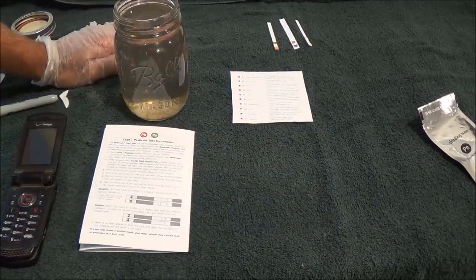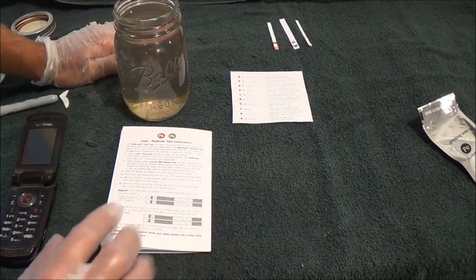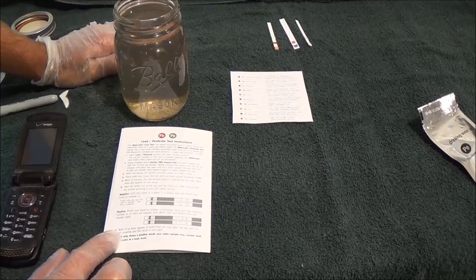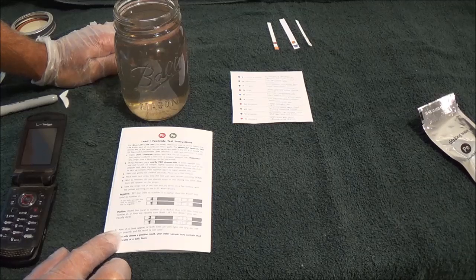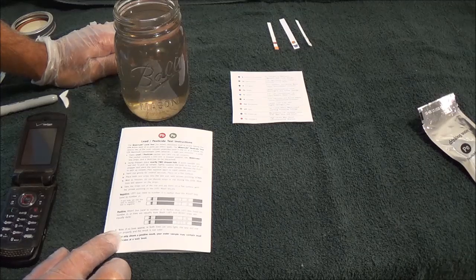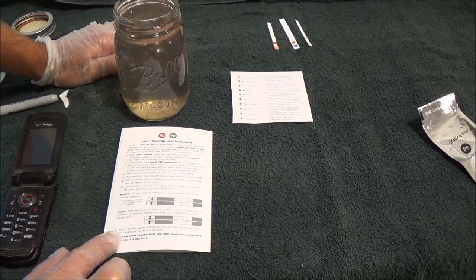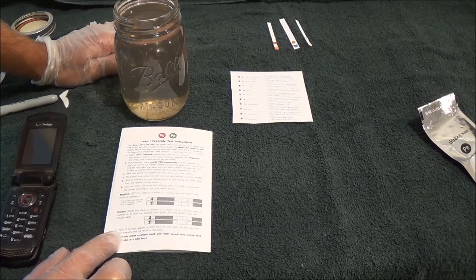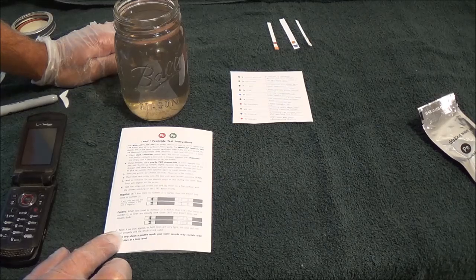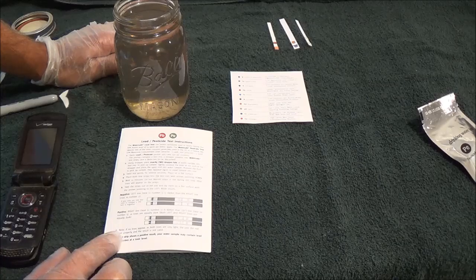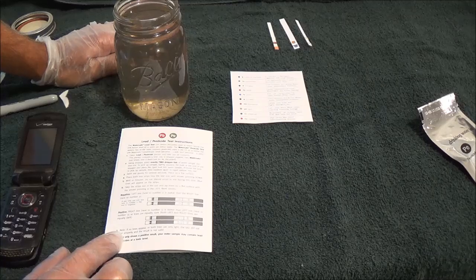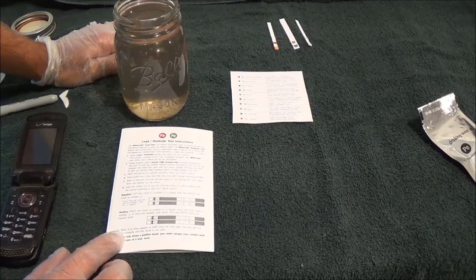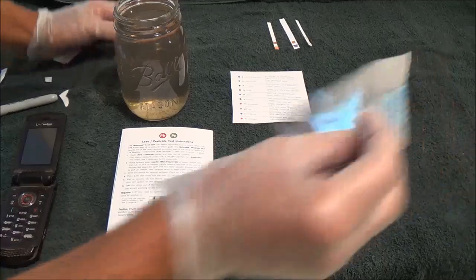Okay, this is for the lead and pesticide test. This one is actually a little bit more complicated. I have to open up the packet. There's a vial in there. I have to put exactly two dropper fulls, not two drops, dropper fulls of water into the vial. Then I swirl it for several seconds and place it on a flat surface. Then I place both of the test strips into the vial with the arrows pointing down. I'm going to wait 10 minutes, pull the strips, and then we'll read the results. Alright, I'll get this one opened up.